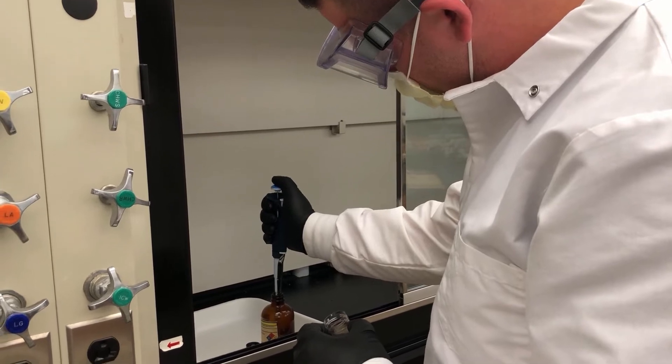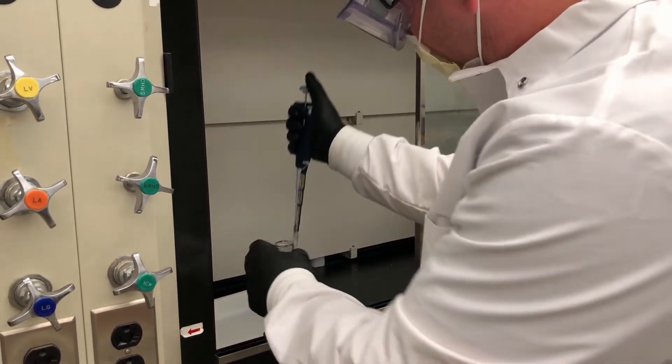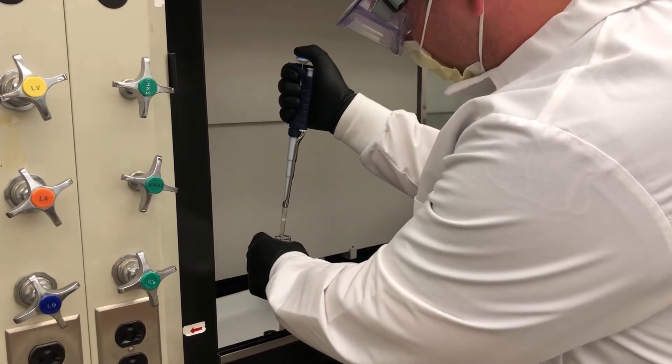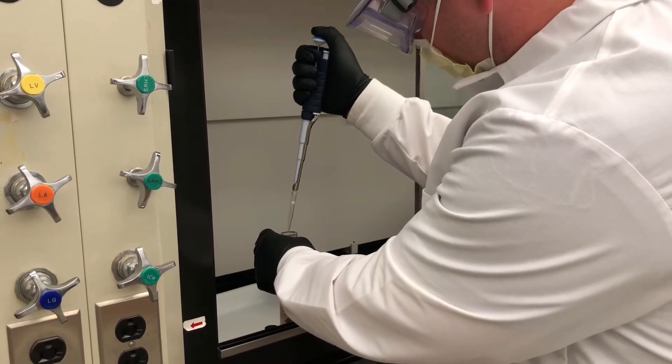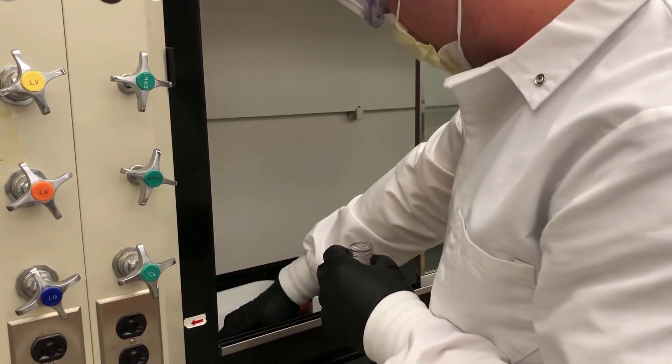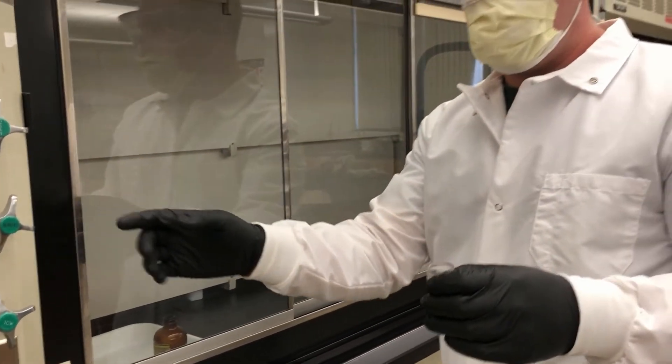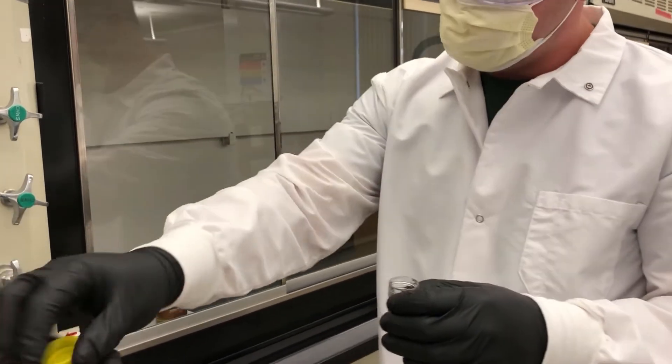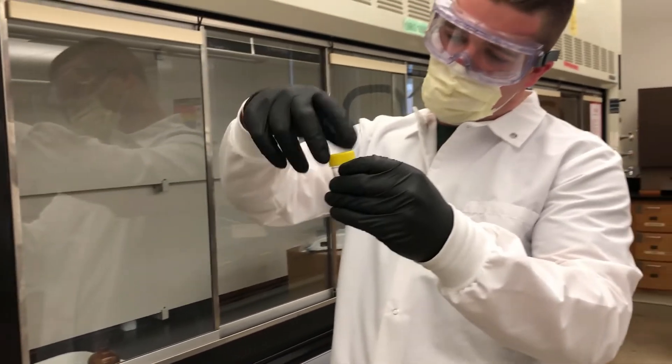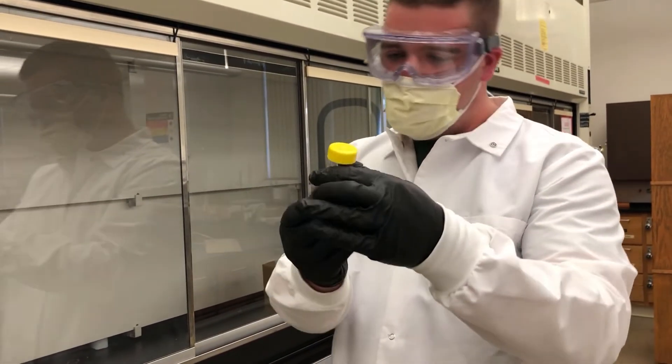So here. I'm going to add it. Okay. I'm going to set that in there and get the cap. Nice. So we got our cap here and we're going to start mixing our ferrofluid with tetramethyl ammonium hydroxide.